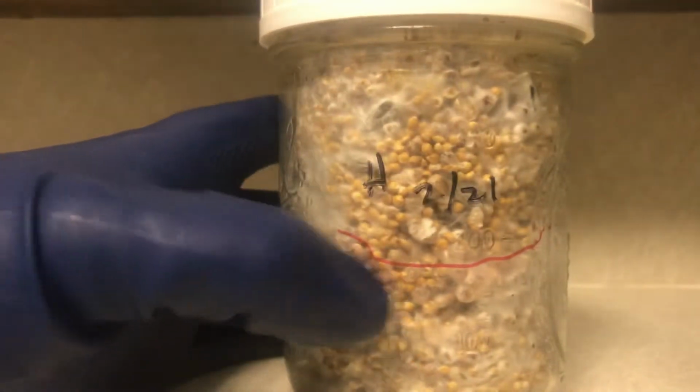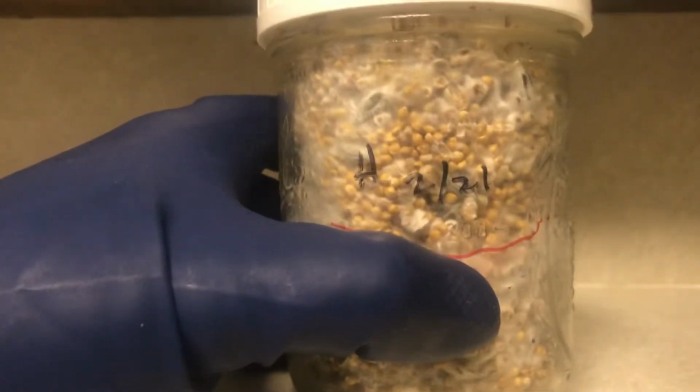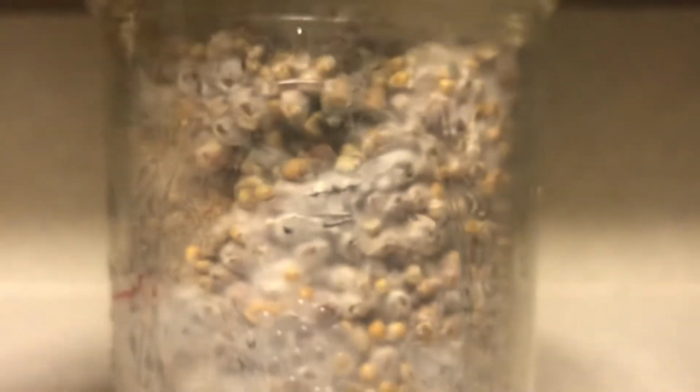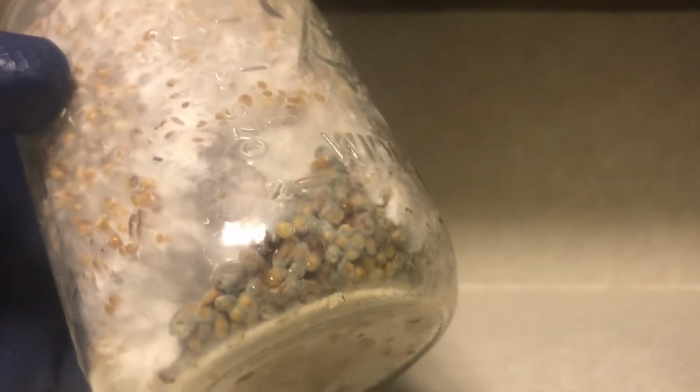And when I first started off, I had a lot of these jars that looked about 99% good. But I will show a close-up right there. There's a small green spot there. And we'll go back and look down at the bottom where there's a much more obvious example of green. And this is called Trichoderma.